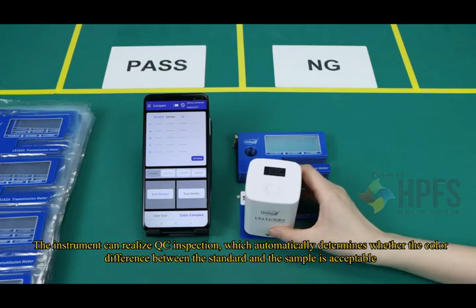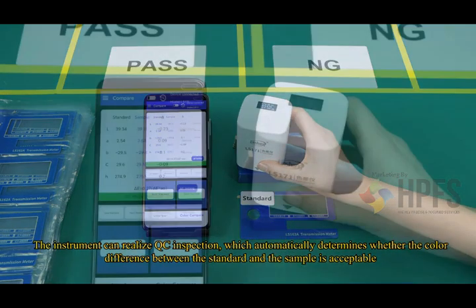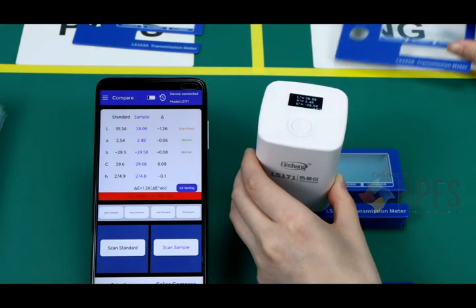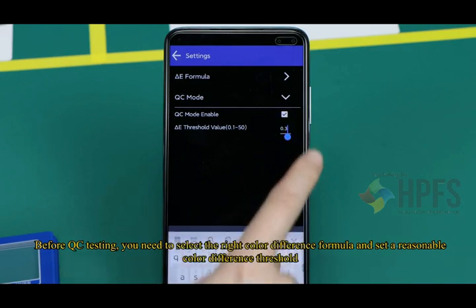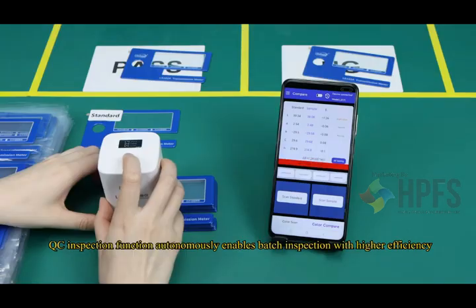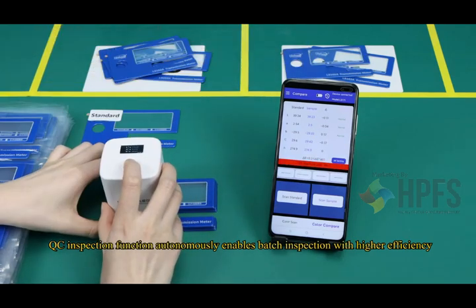The instrument can realize QC inspection, which automatically determines whether the color difference between the standard and the sample is acceptable. Before QC testing, you need to select the right color difference formula and set a reasonable color difference threshold. The QC inspection function autonomously enables batch inspection with higher efficiency.